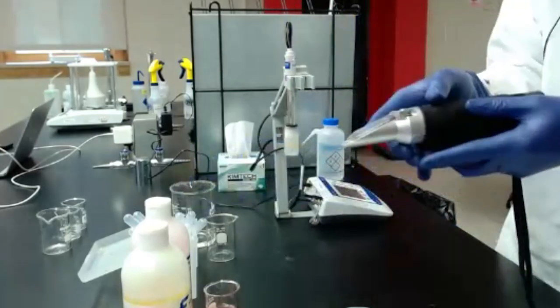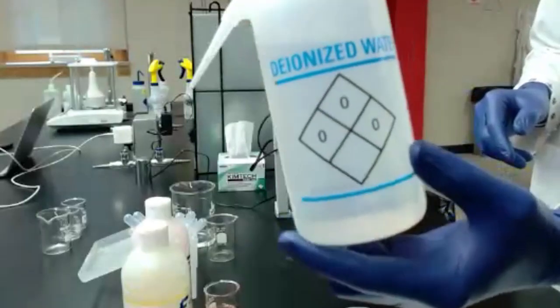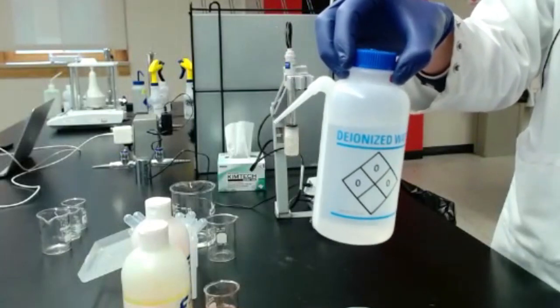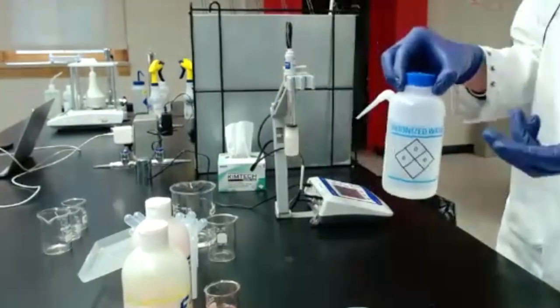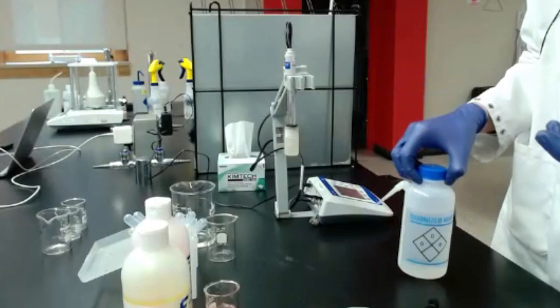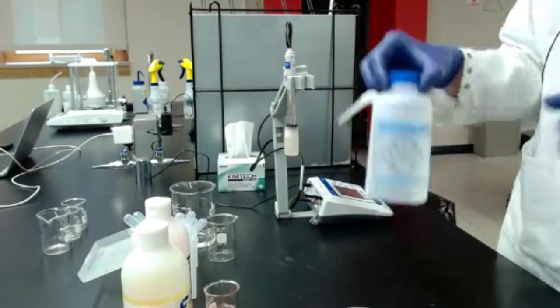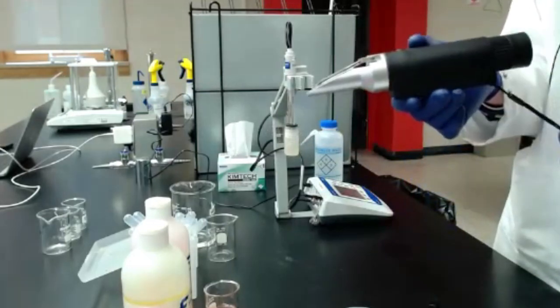But first thing here, got my digital refractometer, my juice. I will also need some DI water, distilled water. We have these fancy little squeeze bottles, but not to worry. If you don't want to buy it, you can boil tap water and then let it cool to room temperature. And again, it's important to use the distilled water because it removes minerals. If you're using tap water, you might risk having chlorine in there, which can lead to cork taint in a winery if it gets in. So make sure you're using chlorine-free water around your winemaking equipment, and then just best for the longevity of our equipment.